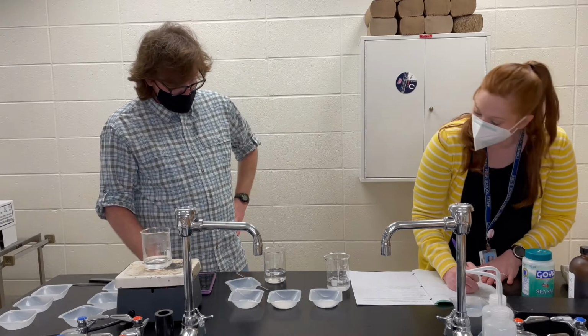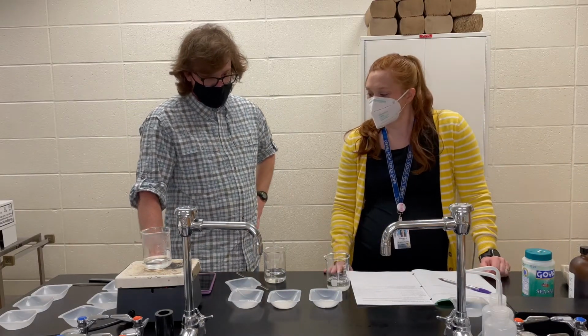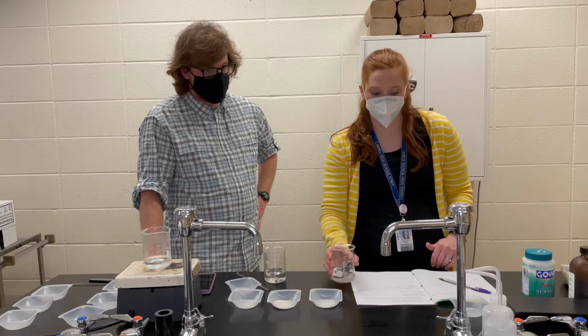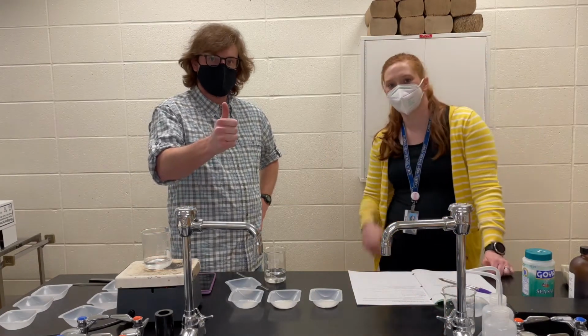We're just gonna keep this one going. We're gonna set this off to the side so that we can come back to it later because I'm getting bored waiting. So I'm gonna move this off. We'll come back to this and see how long it takes. I'll keep the timer going. We'll let you know.